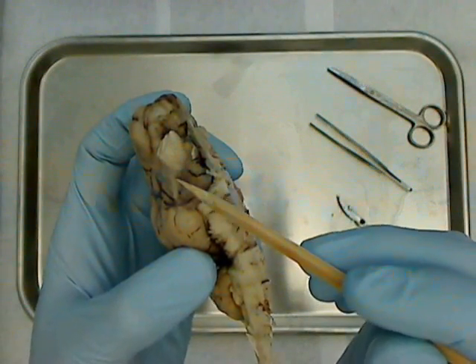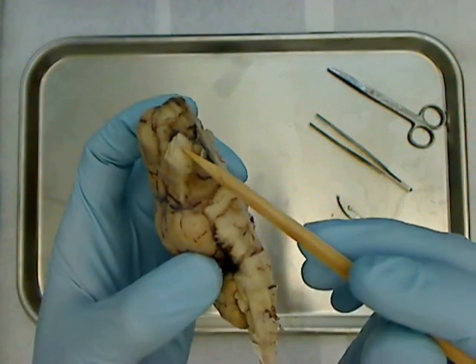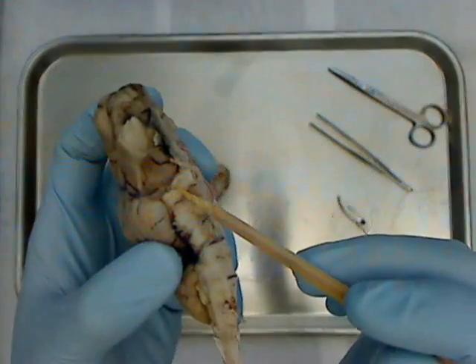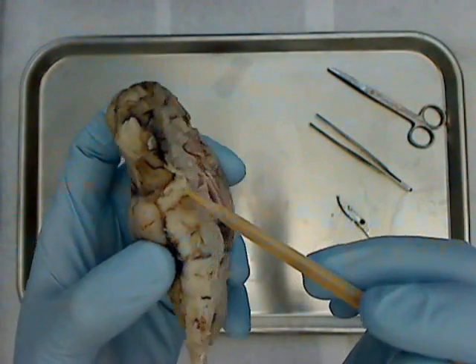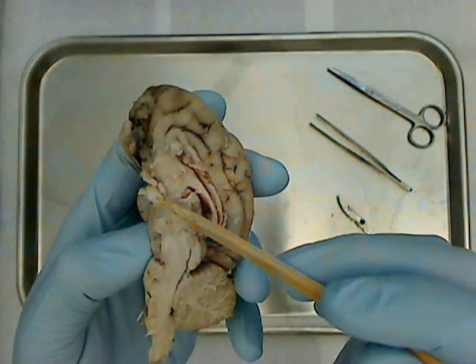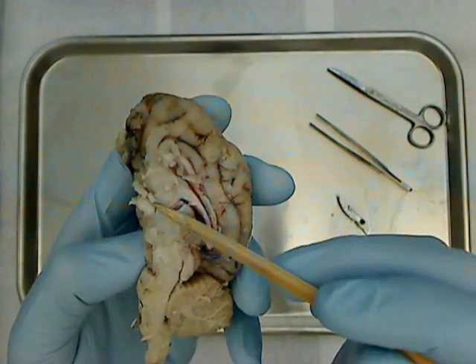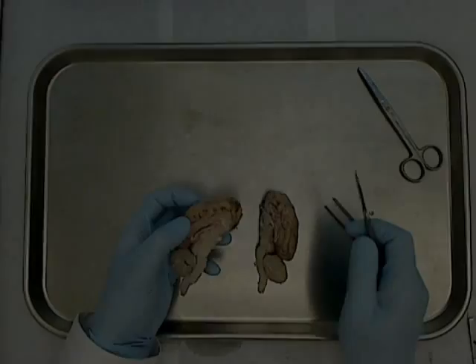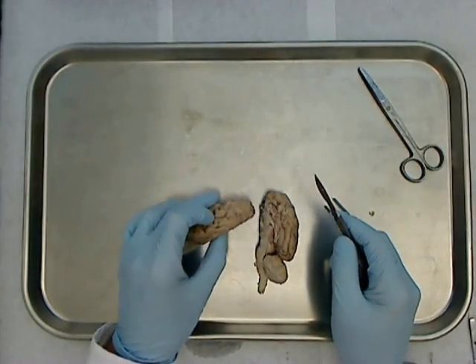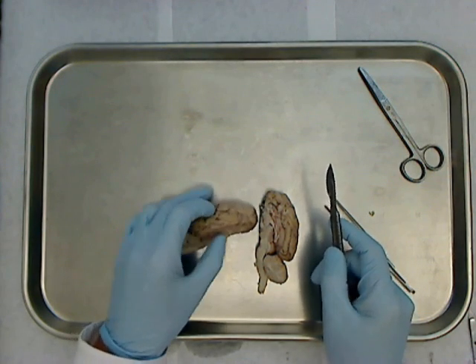Cerebellum is here, and you can nicely see the whitish tissues of the arborvitae. Cerebrum, of course, up here. Cranial nerve number one or the olfactory nerve here. Optic chiasm here.